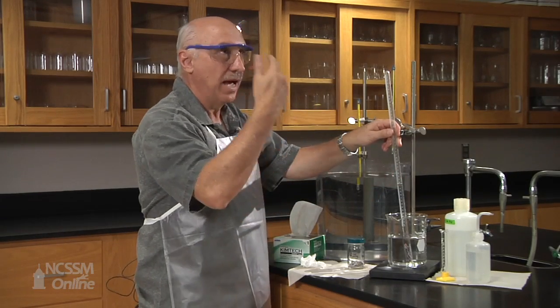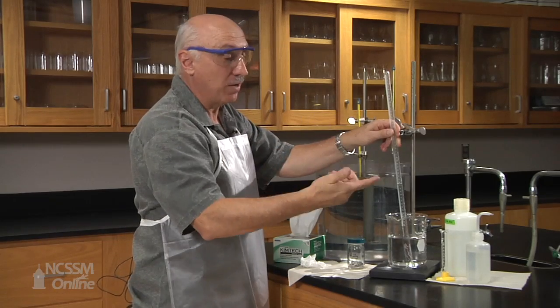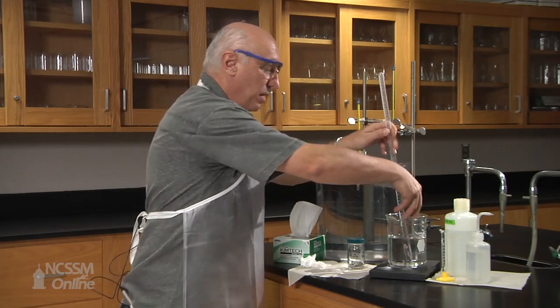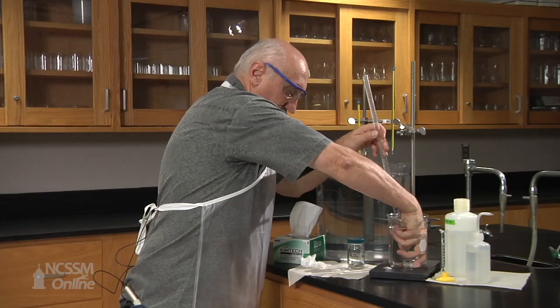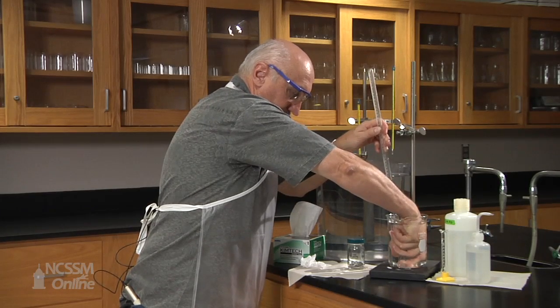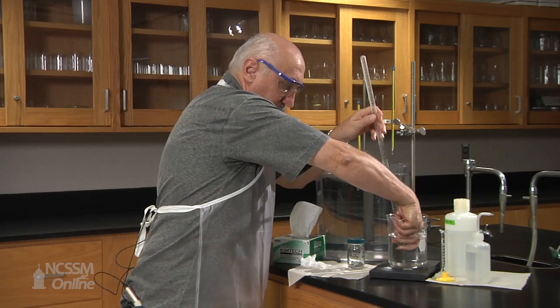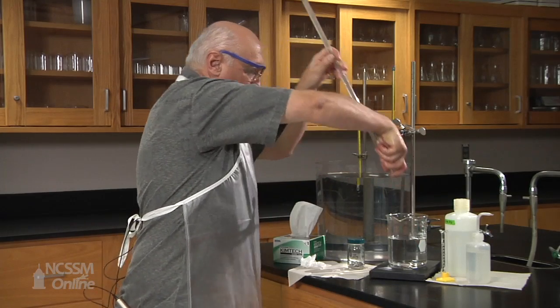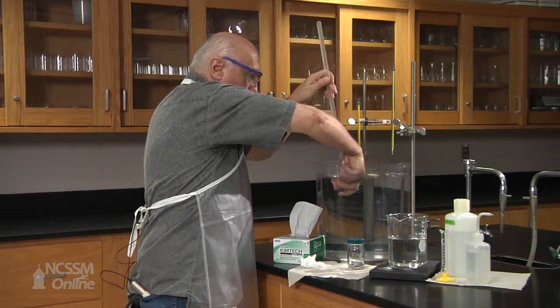At atmospheric pressure, current atmospheric pressure. In order to do that, we have to take this tube, being careful not to lose any liquid out of here, and we place it in a bath of water.